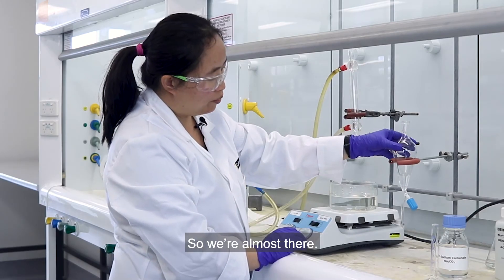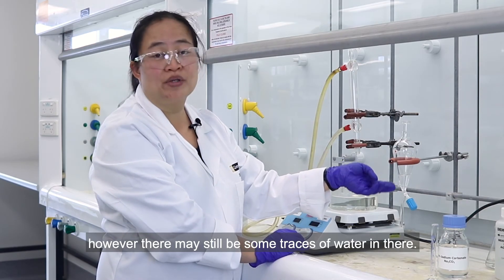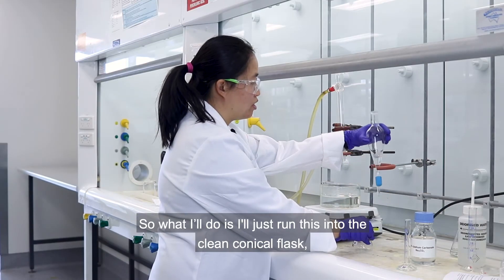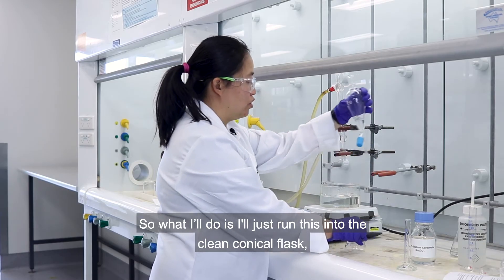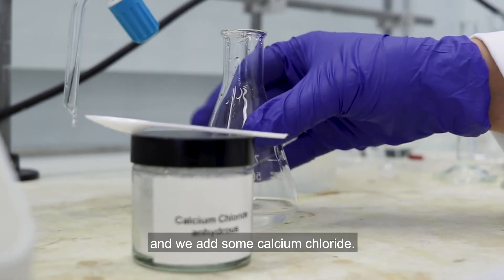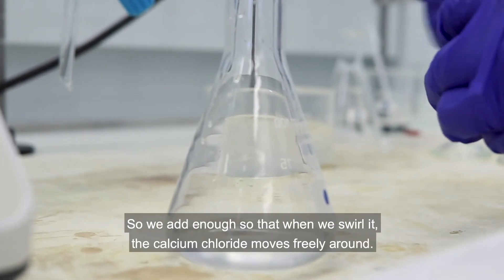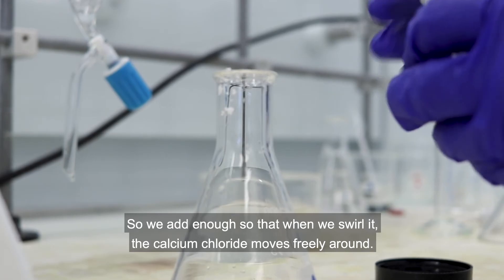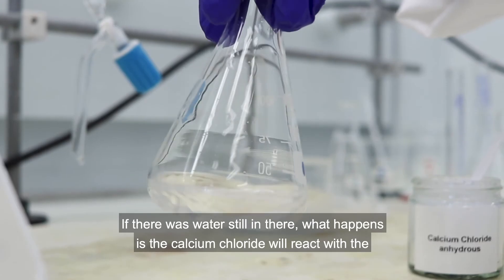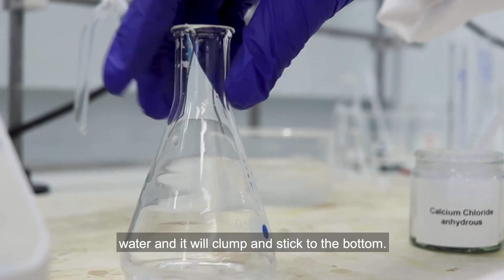So we're almost there. We have our product in our organic layer, however there may still be some traces of water in there so we need to remove that. I'll run this into a clean conical flask and add some calcium chloride. The amount we add depends on how much water we have — we add enough so that when we swirl it, the calcium chloride moves freely around. If there was water still in there, the calcium chloride will react with the water and it'll clump and stick to the bottom.